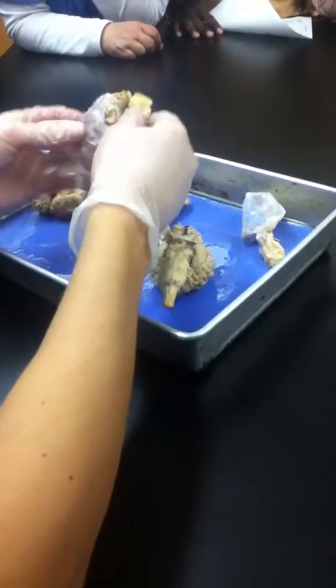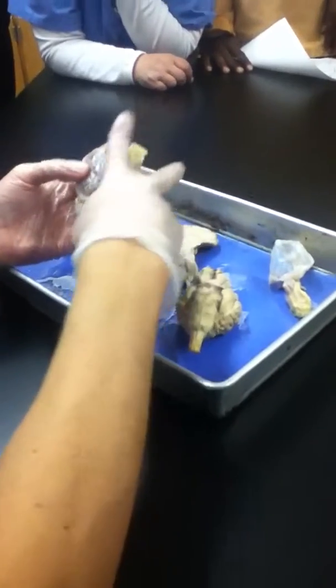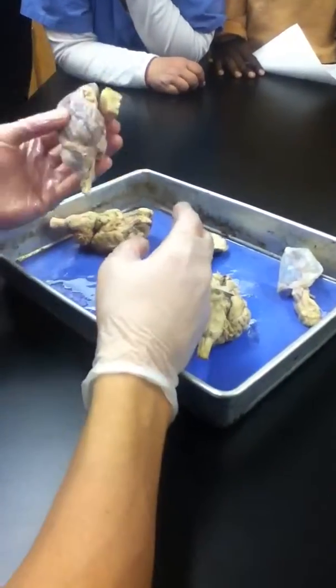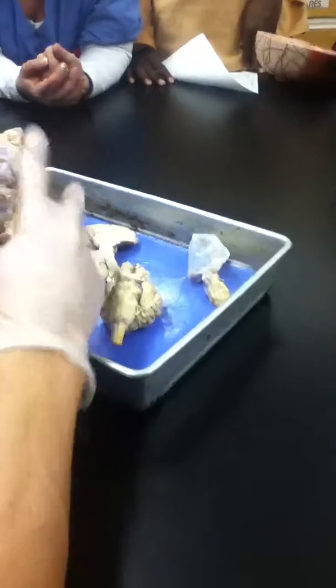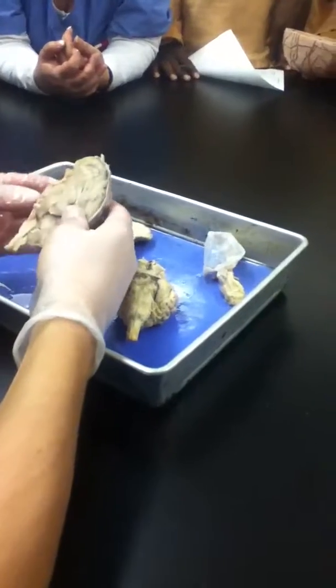So actually, we do sheep eye dissection in A&P 2. They basically cut here, put it in one bucket, and put this in the other bucket, so it's like sheep heart. I keep saying that because I do sheep hearts all the time too in A&P 2. Sheep brain in one bucket, snip, put the eye in the other bucket, now you've got two different dissections to do. Nice. Yeah, it's a twofer.